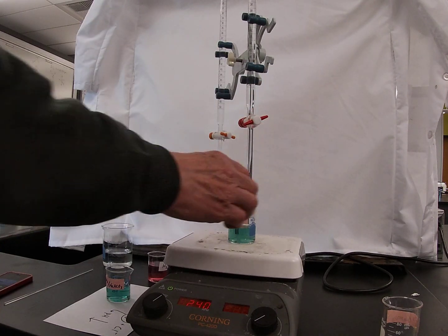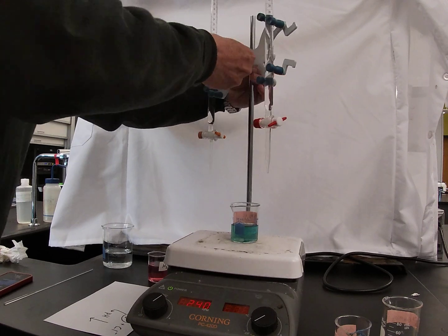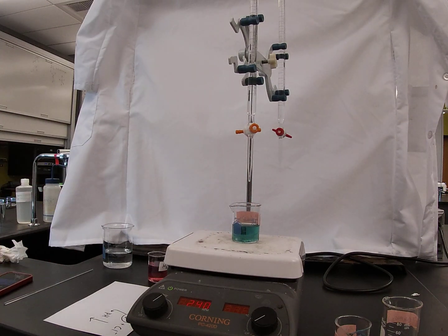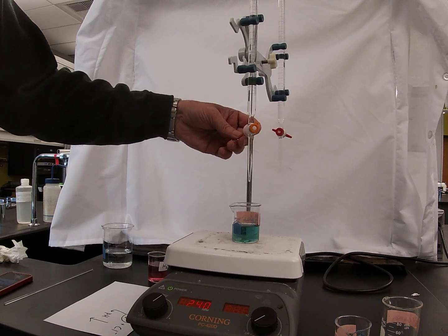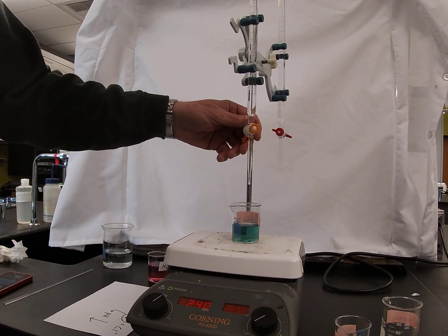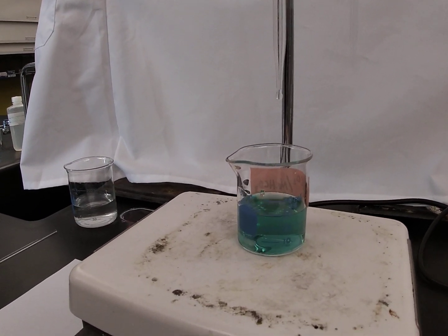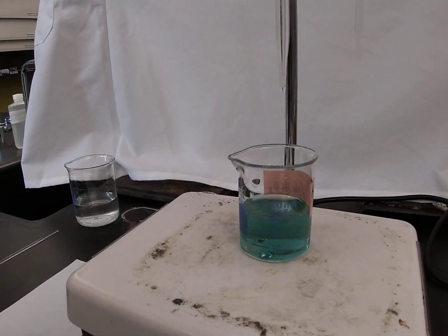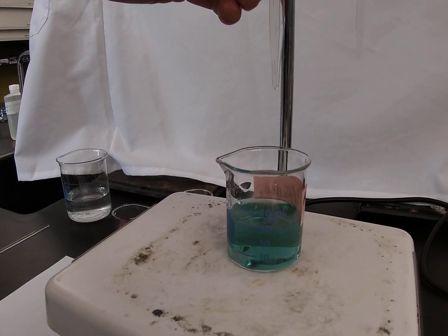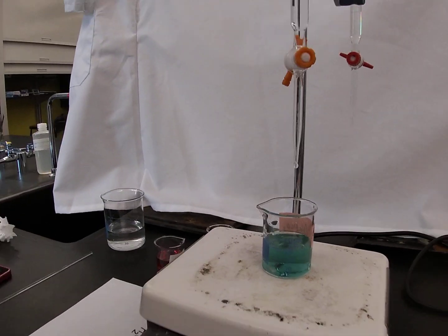We'll turn that off, set that aside, and bring up our second beaker of buffer. Bring around our sodium hydroxide burette, and now start that experiment again with a slow drip. 1, 2, 3, and so on up to 17, and just like last time, because the color is not changing, we infer that the pH also is staying relatively the same as it was when we started. That bluish greenish color is suggestive of a relatively neutral pH.